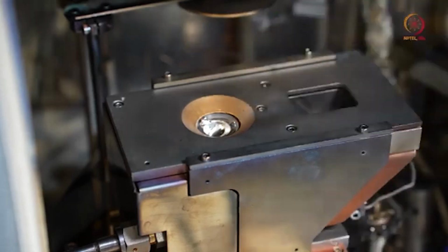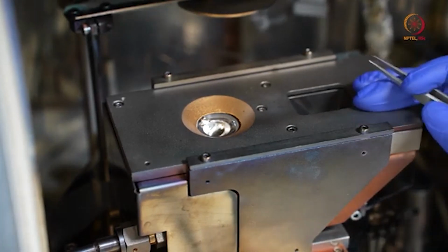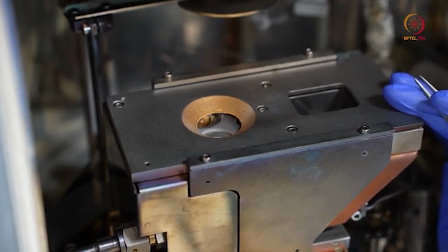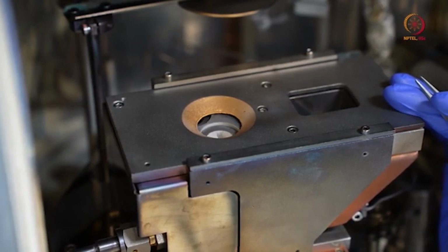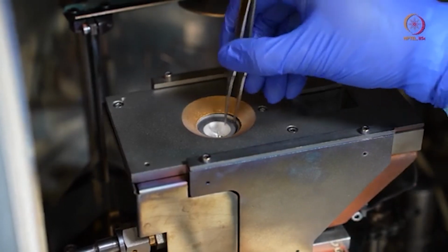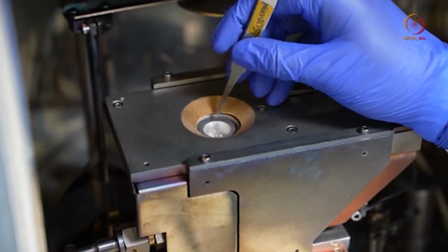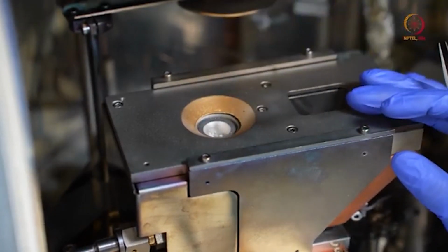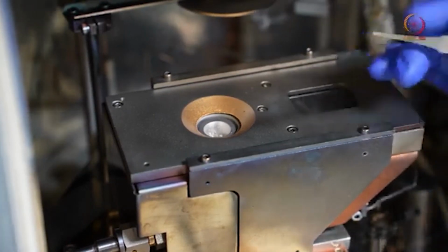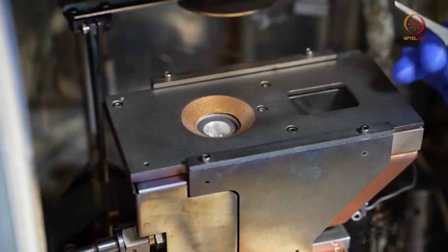So you should take care of this. This is aluminum, and as the next one we will show, you can see here this is platinum. As already discussed the other day, whatever patterns we have, we want titanium and platinum, basically platinum as the metal layer and titanium as the intermediate layer or the adhesion layer.